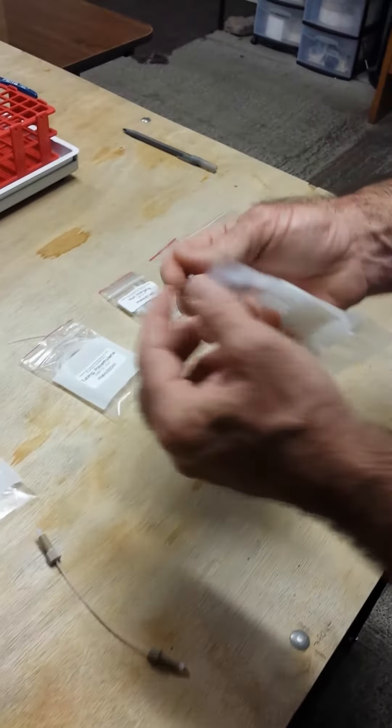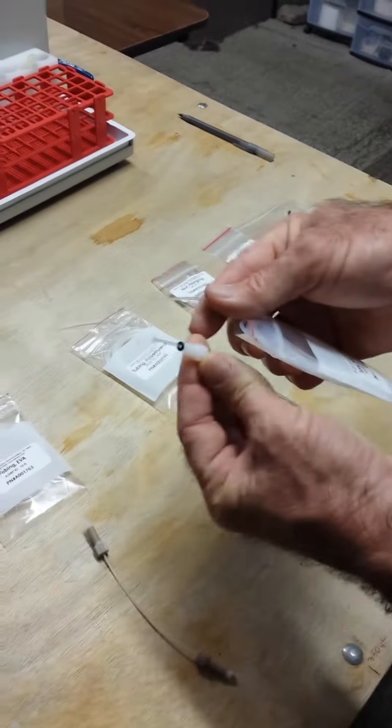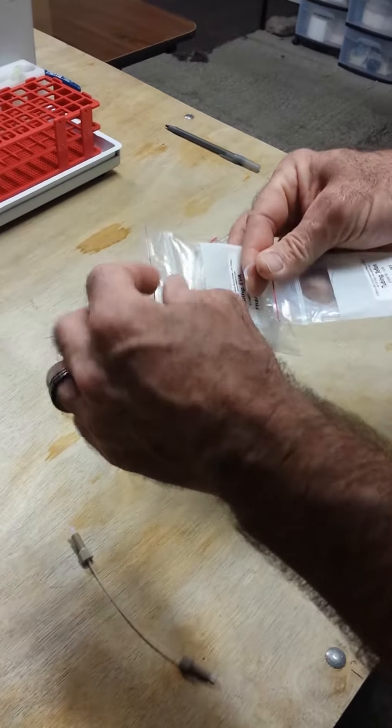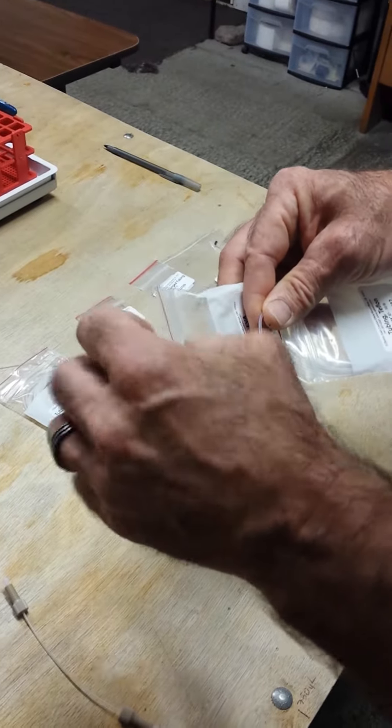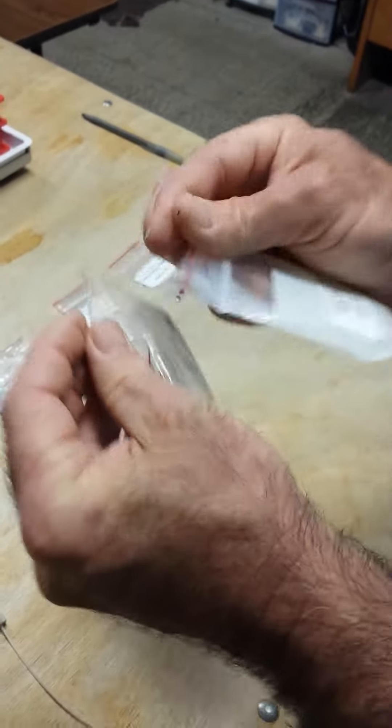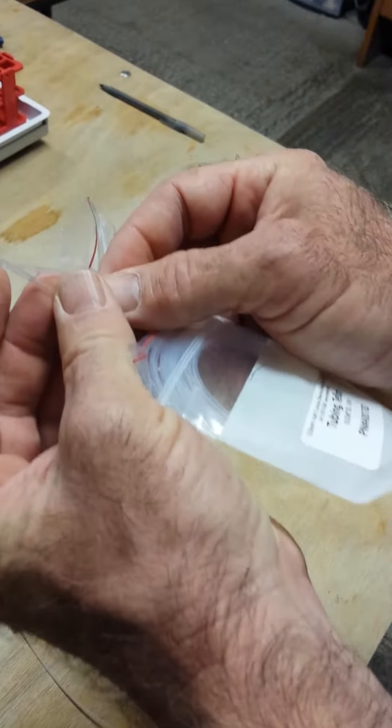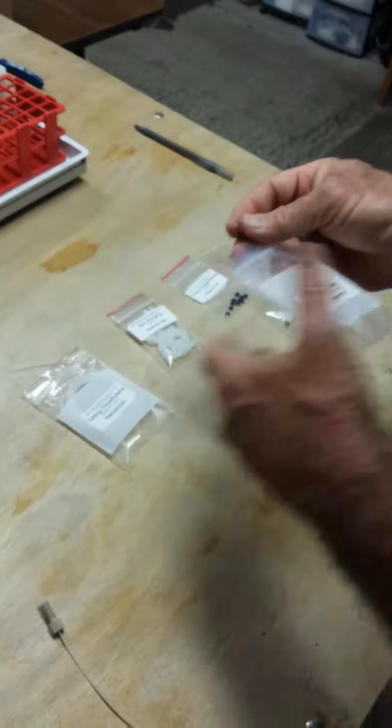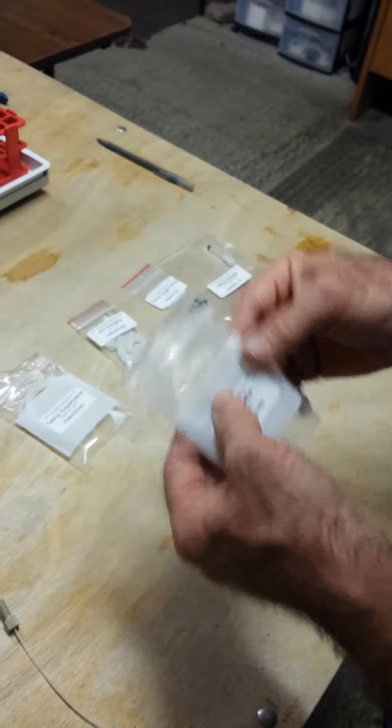The Teflon tubing is the tubing that will be flanged. It's actually quite difficult to tell this tubing apart from each other initially if you don't have a lot of experience with it. You have different IDs and different colors, but you just really need to keep them in their packages.